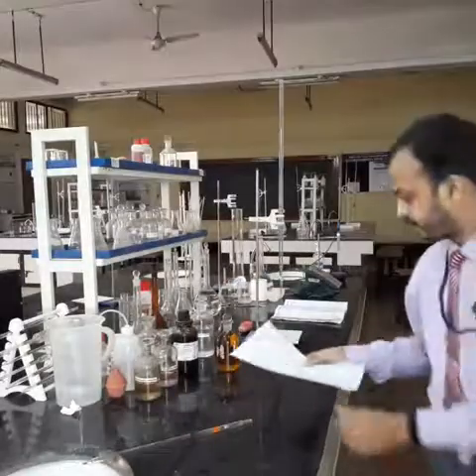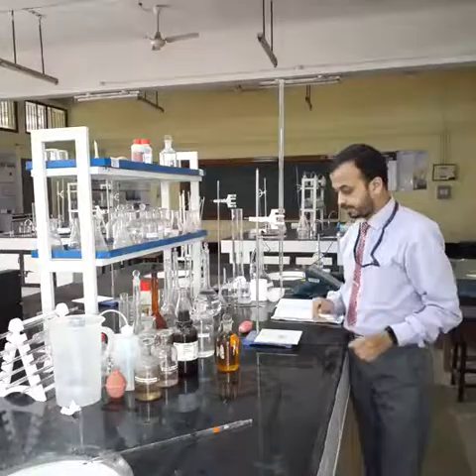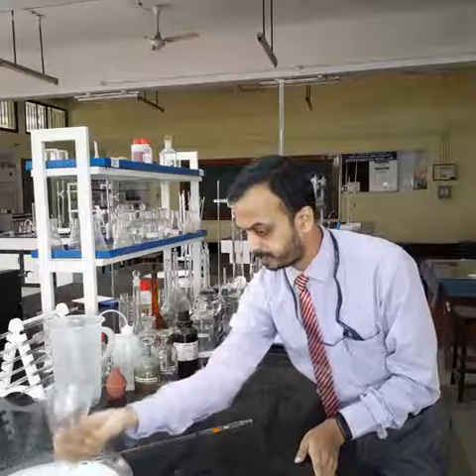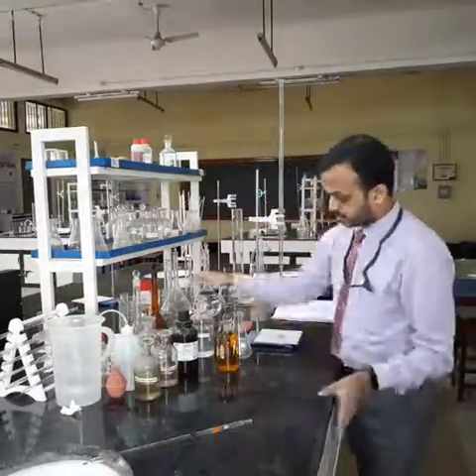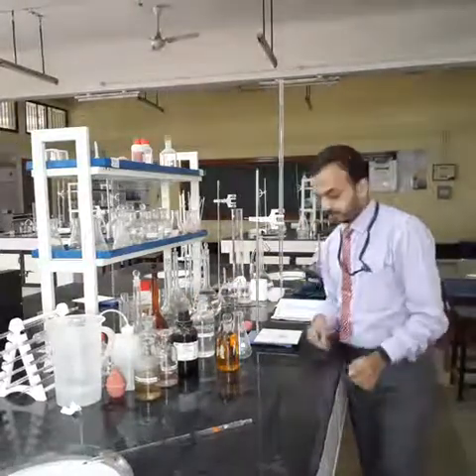For 200 ml, what should be the sample to be taken to identify the DO of the sample? When we calculate it, it comes out to be around 203 ml. So I will take 203 ml of the given sample in a conical flask and then titrate it with the solution of sodium thiosulfate of 0.025 normality.